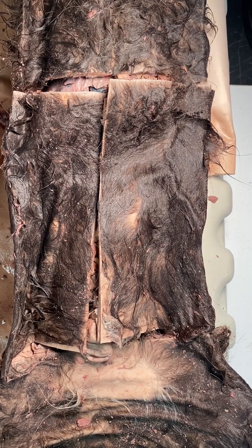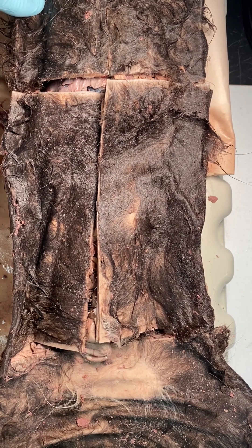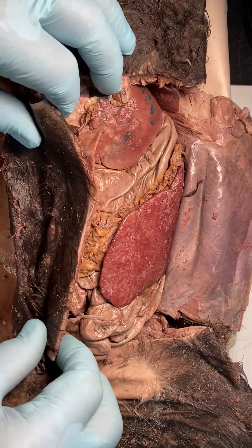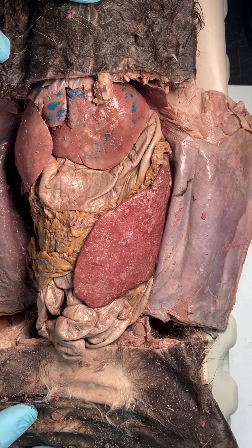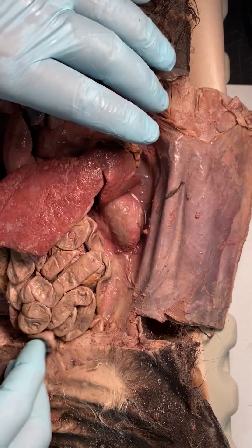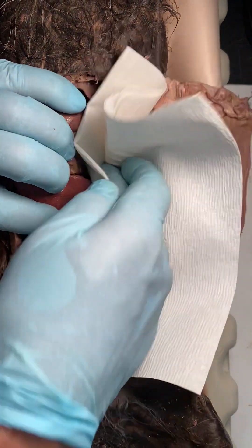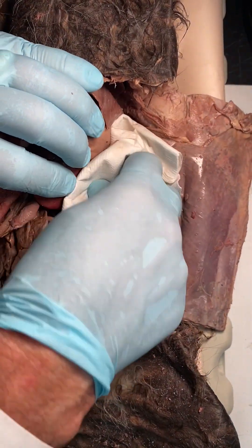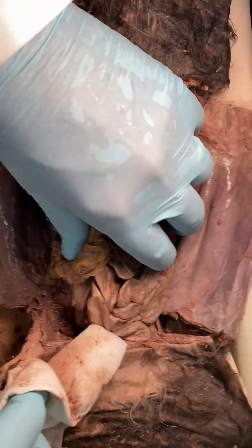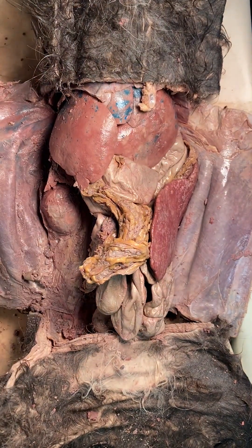This is the third video on the arteries of the lower half of the cat. I'll be spending less time on dissection techniques and focusing more on the structures you need to identify. I've already opened up the abdomen. If you get a cat with a lot of brown stuff inside, wash it out thoroughly. The dark stuff is dry blood that accumulated in the abdominal pelvic cavity.